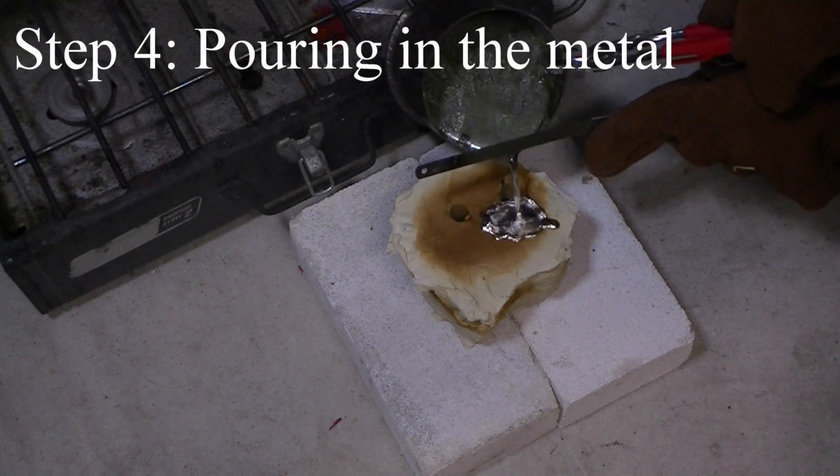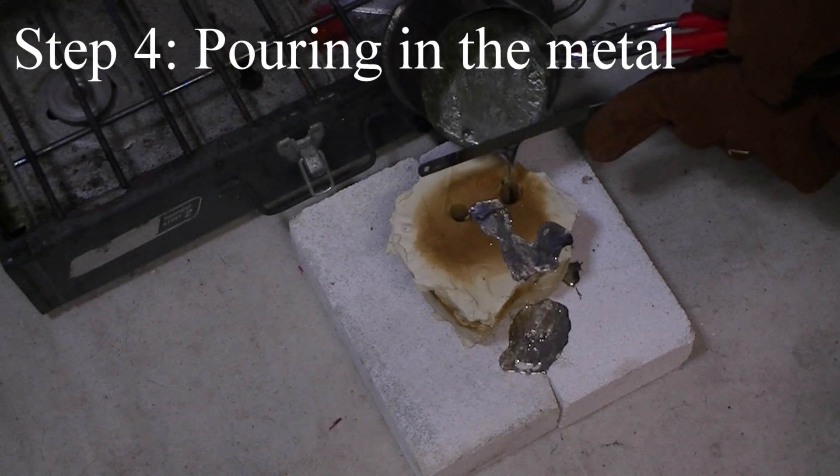Now using not so steady a hand, the molten bismuth is poured into the mold.